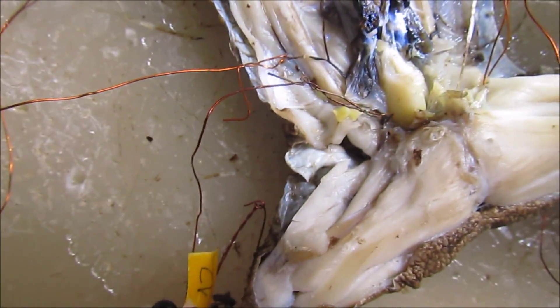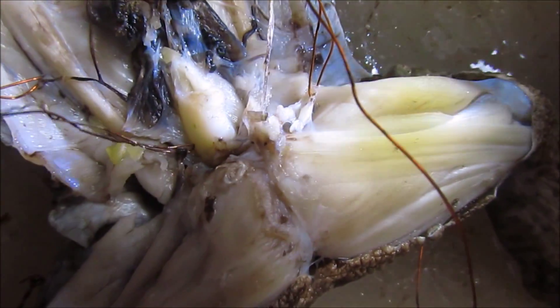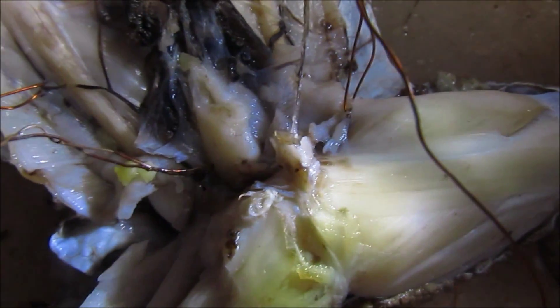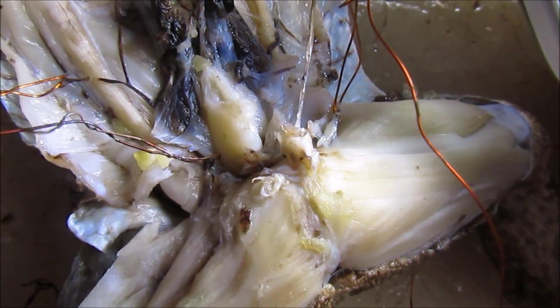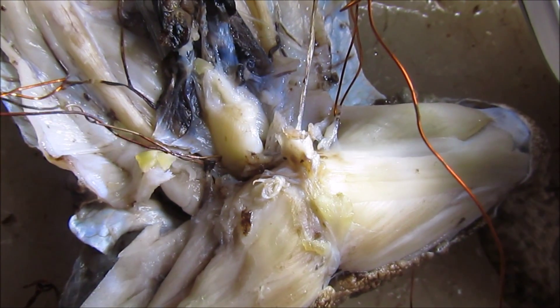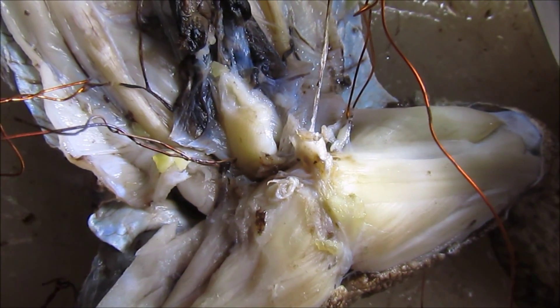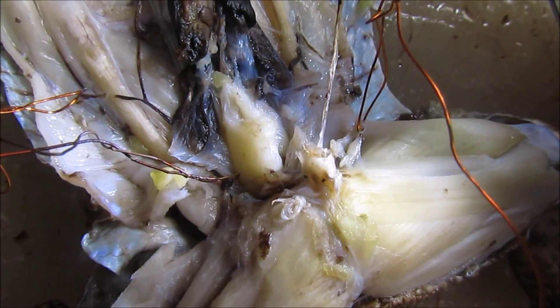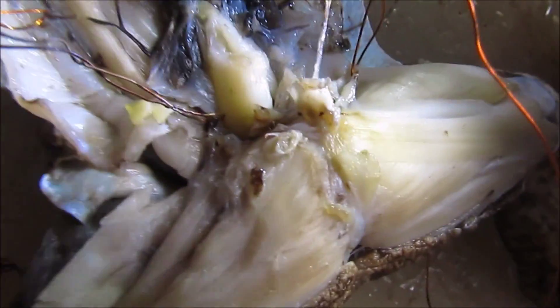Next is the femoral vein — this one. The difference between femoral and pelvic: usually if femoral, open the muscles. Look at this one.